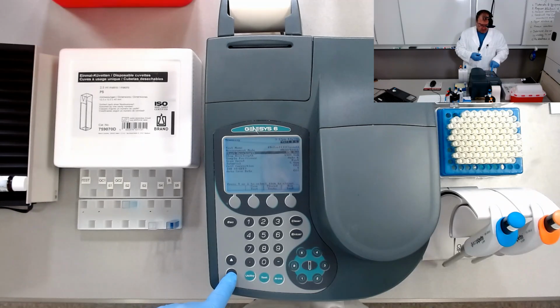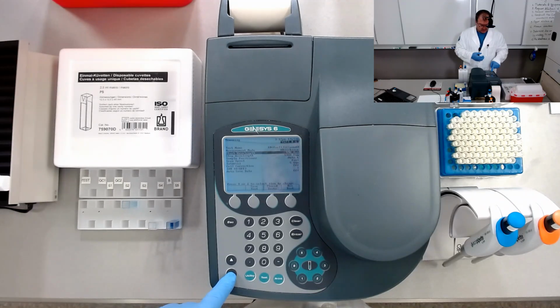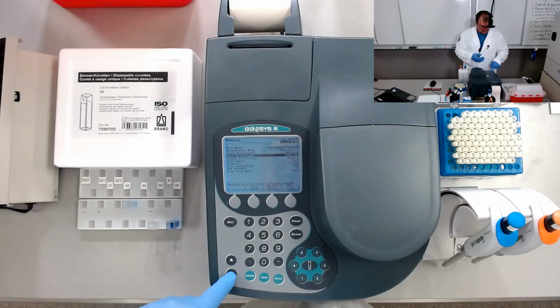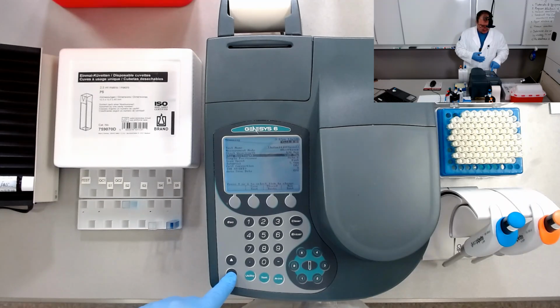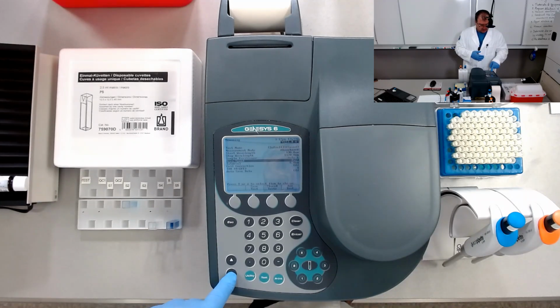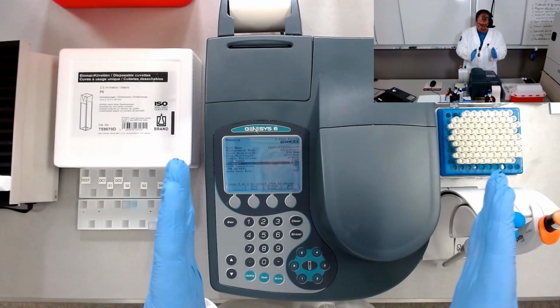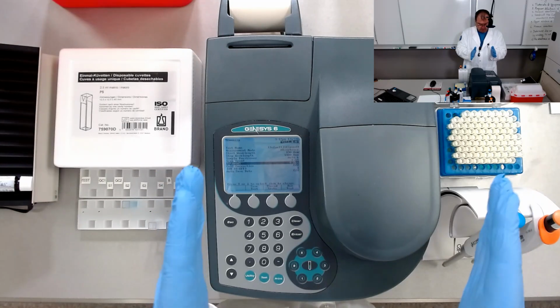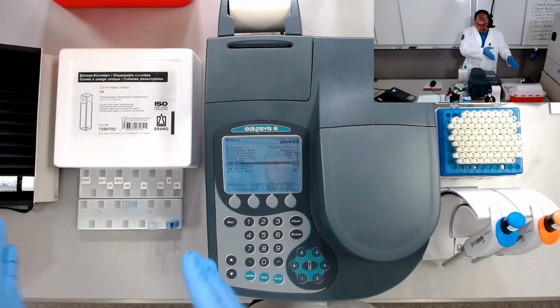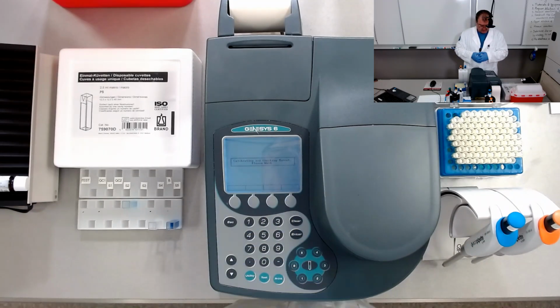Start wavelength 190 nanometers, deep in UVC. Stop wavelength 1100 nanometers in infrared. Sample position 6, auto 6, which is the carousel, and the scan speed fast, and the interval 5 nanometers. So the measurements will be taken at 5 nanometers from 190 nanometers to 1100 nanometers. So let's run the test.